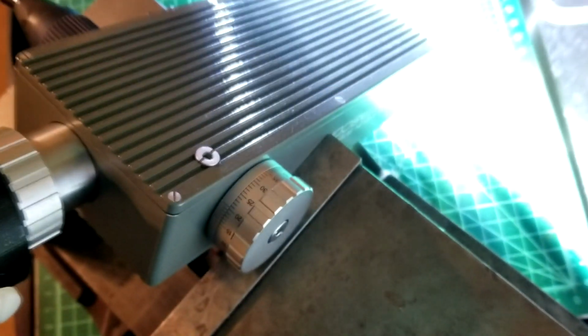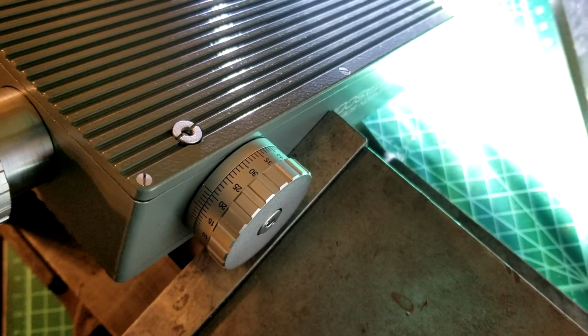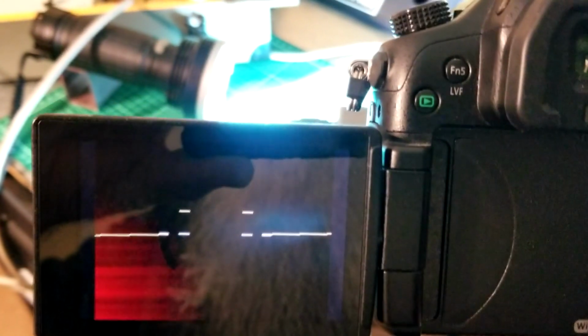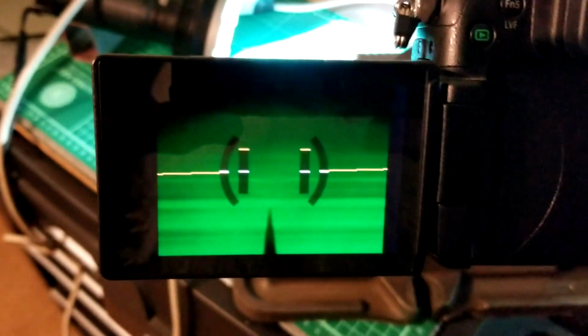There's a dial here on the side. And if I sit here and move it to read the spectra, even though this isn't a spark right now, it's just a flashlight, you can see that I can sort of slide through it. So I guess what I'm saying is, I know that the adapter is working. What I don't understand is why I can't see any spectra lines with this thing when I fire it up.